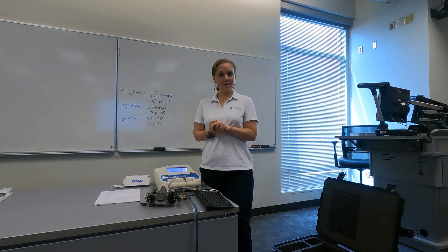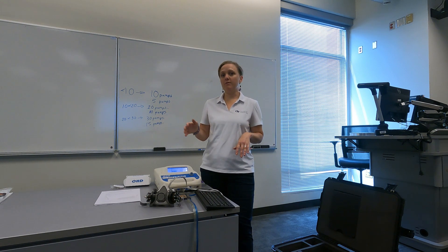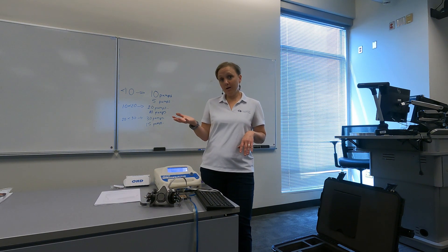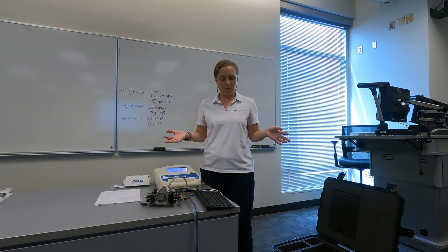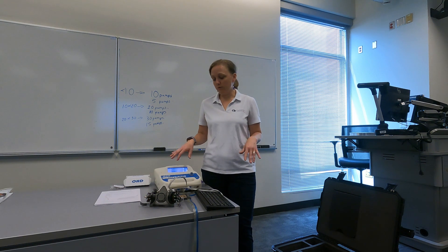There are two main ways that you can do quantitative fit testing: you can use the PortaCount or the OHD quantifit. There are some other methods of doing quantitative fit testing, but those are the two main ones that you may have heard of.